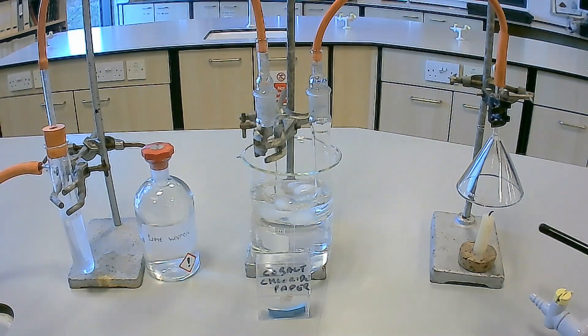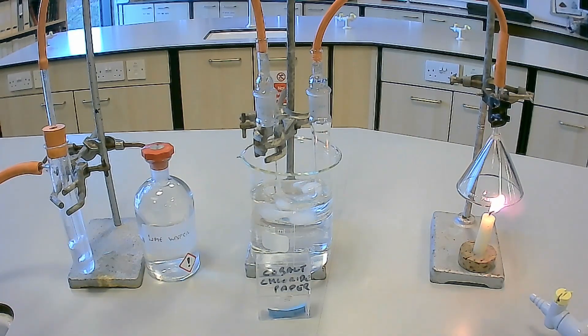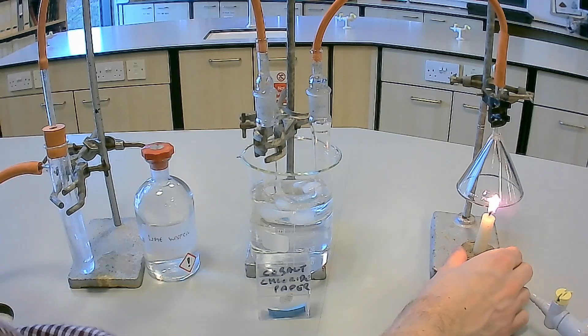Finally, a candle is lit using a flame and placed under an upturned glass funnel. The glass funnel is connected by a piece of rubber tubing to the U-shaped tube which is then connected by another piece of tubing to a glass tube inserted into the lime water.